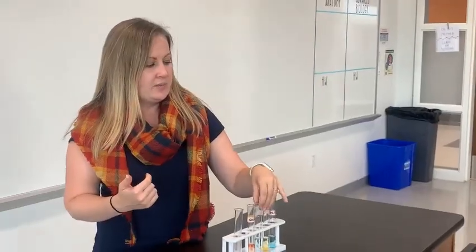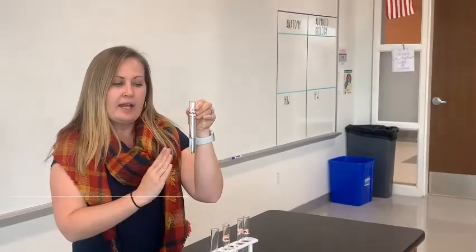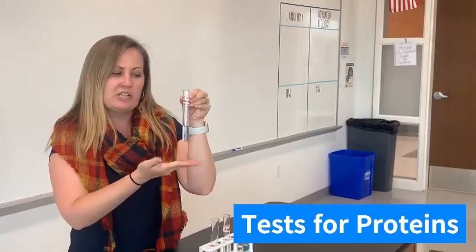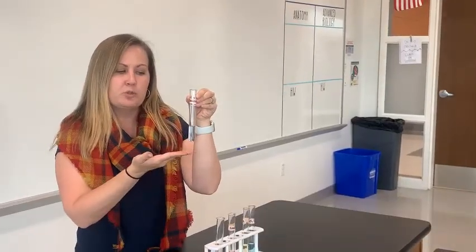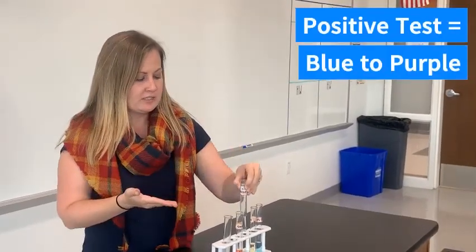Then we did the Biuret test. Biuret detects the presence of proteins. When it changes from this blue to a purple, we know proteins are present.